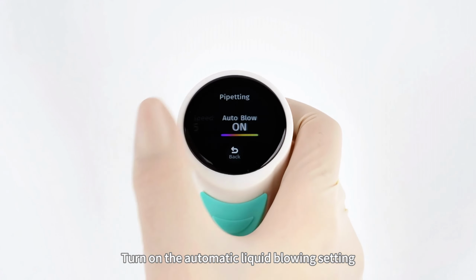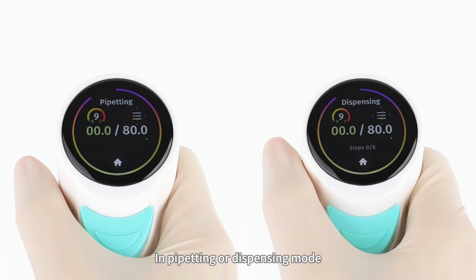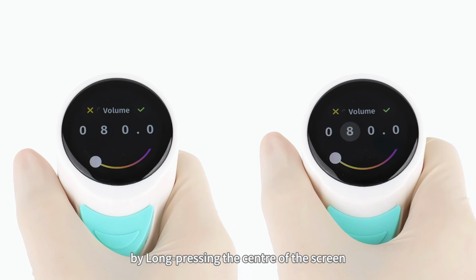Turn on the automatic liquid blowing setting. The device will automatically blow liquid after completing a suction and discharge. In pipetting or dispensing mode, volume parameters can also be edited quickly by long pressing the center of the screen.